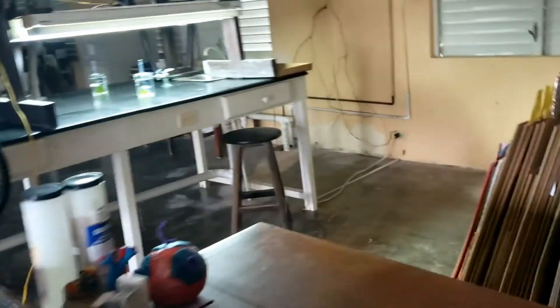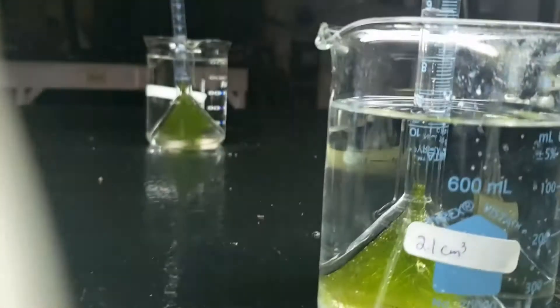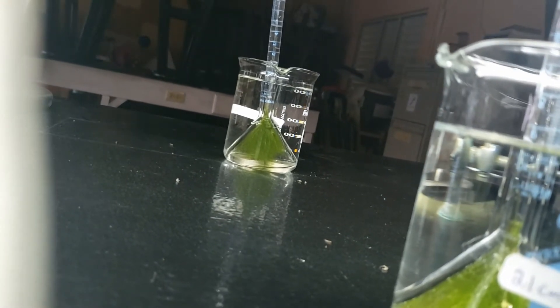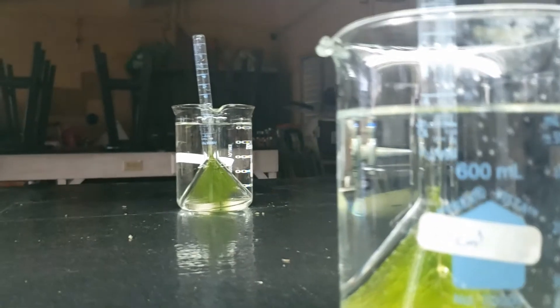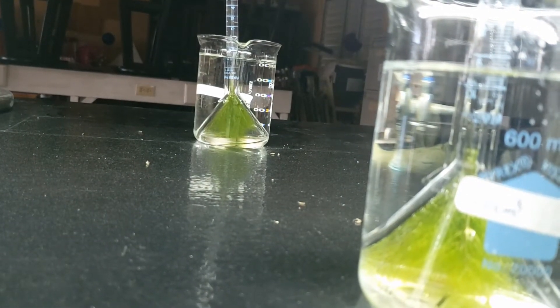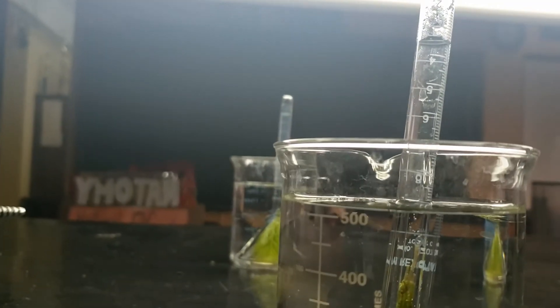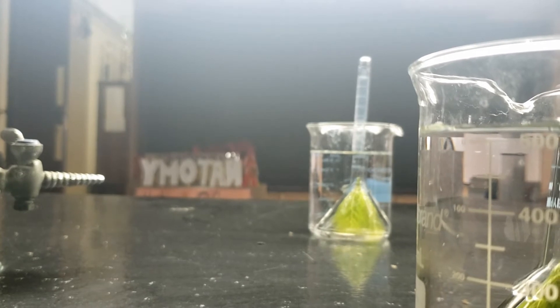After leaving the experiments for an hour in their varied conditions, we came back and observed the change in volume inside the test tubes. As you look closely around the leaves inside the funnel, you can actually see a lot of air bubbles, which are oxygen being produced. The two experiments placed under the growth lamp have a fair amount of oxygen being produced, as shown by the amount of bubbles inside the funnel. Looking closely inside the test tube, you might also see some bubbles being produced or collected from the stem.